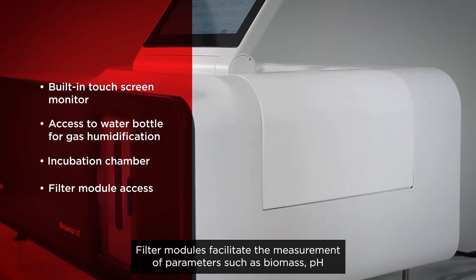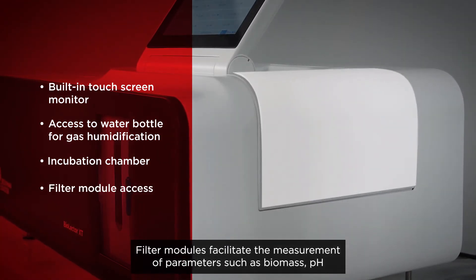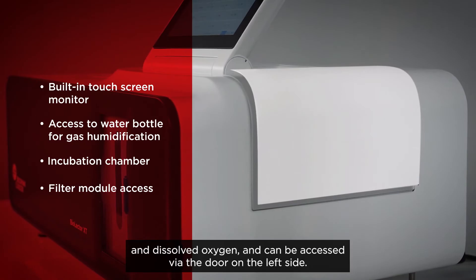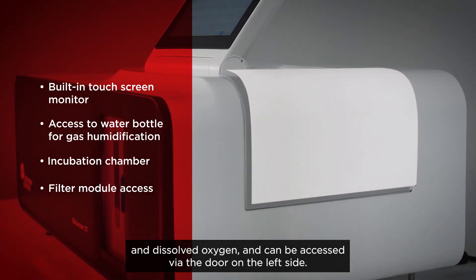Filter modules facilitate the measurement of parameters such as biomass, pH, and dissolved oxygen, and can be accessed via the door on the left side.